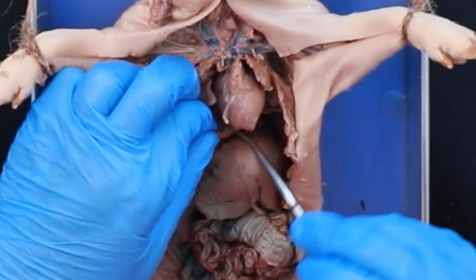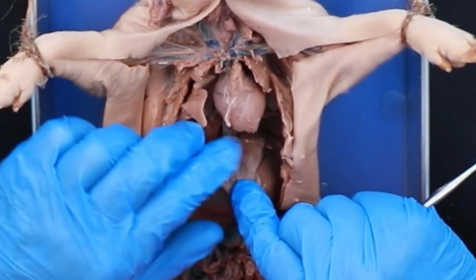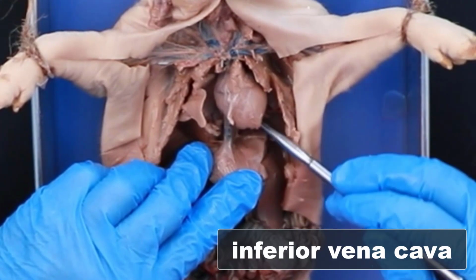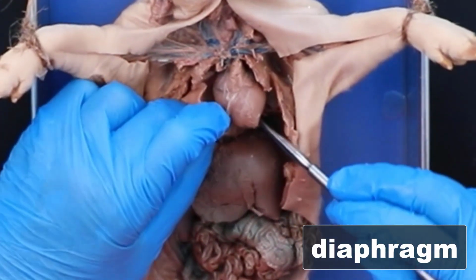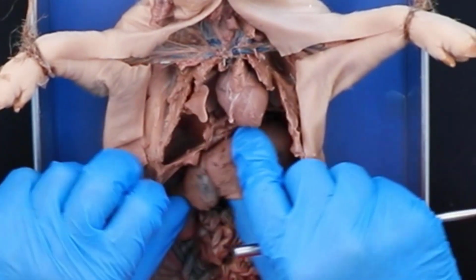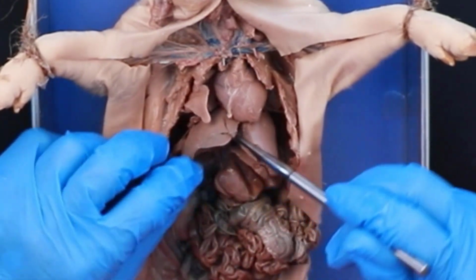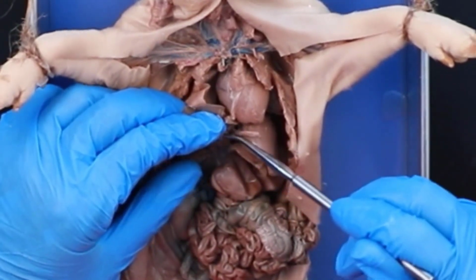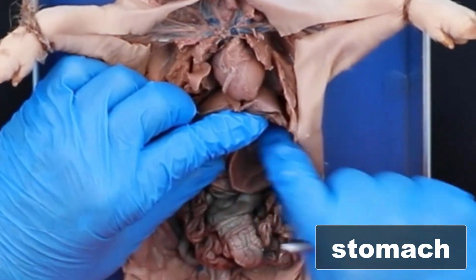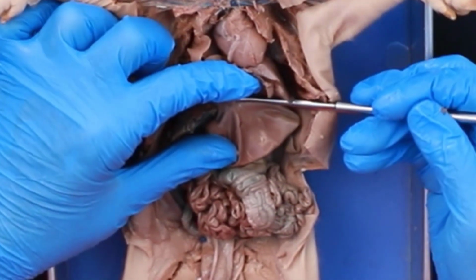So we're going to come through the diaphragm. We've cut the diaphragm back, but this is actually it. And you can see that lovely little inferior vena cava coming up. But there's your diaphragm. And we run into the big liver right here. And we have the gallbladder, which is right here. It's not really easy to see, but there it is right there. And then we move into the stomach. So you can see the stomach. Here's the esophagus actually coming into the stomach right here.